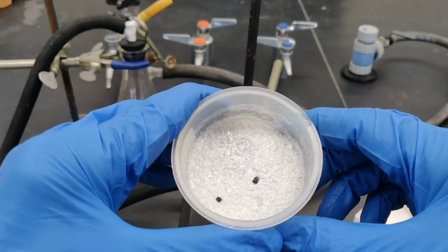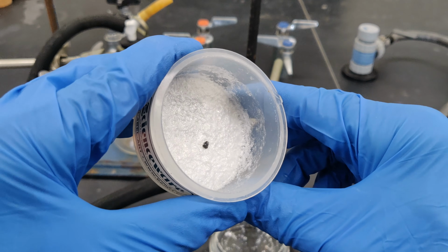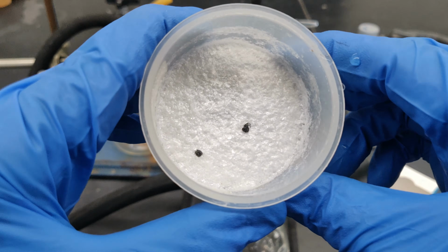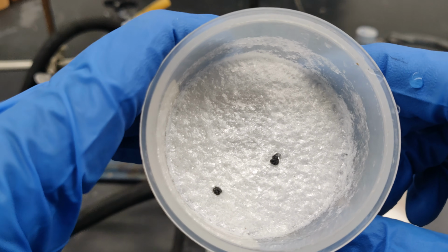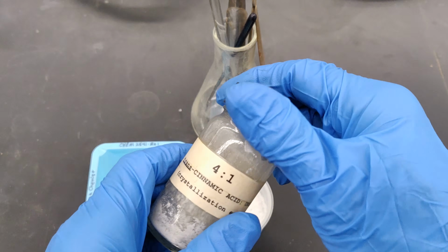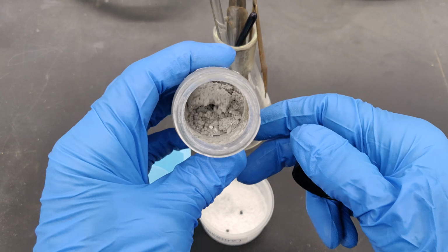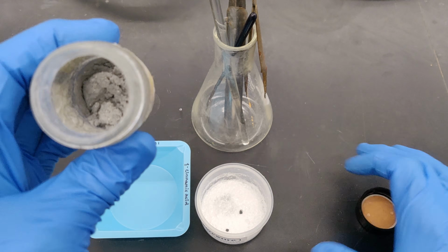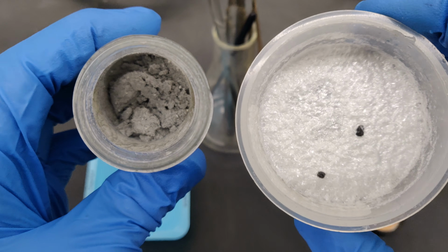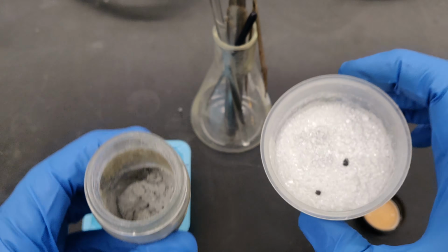If all went well, in the Buchner funnel you should find shiny white crystals of purified cinnamic acid along with any boiling stones you might have added. There is a notable difference in appearance between the impure mixture you started with and the final recrystallized product in the Buchner funnel.